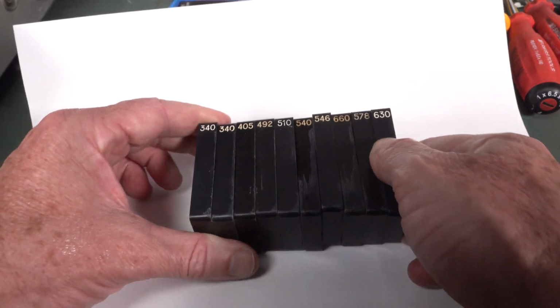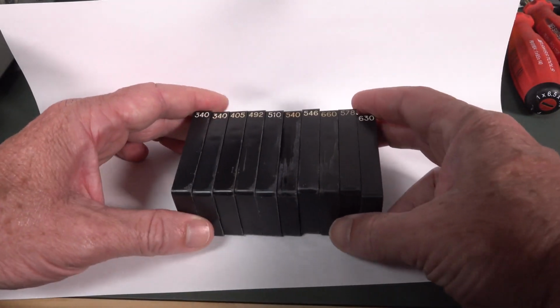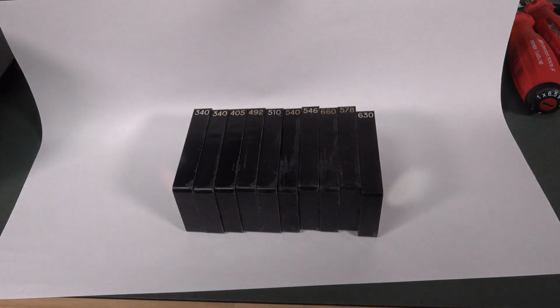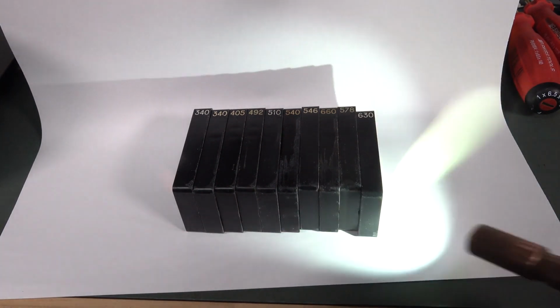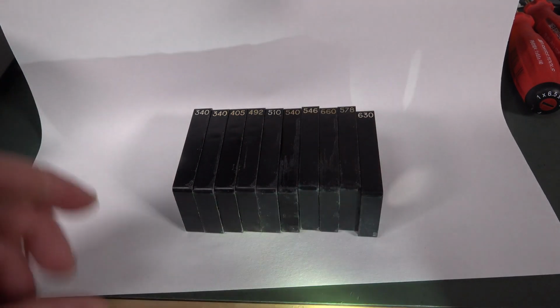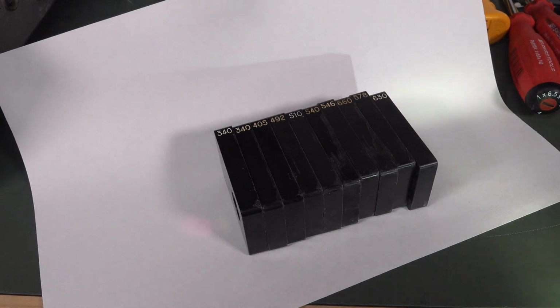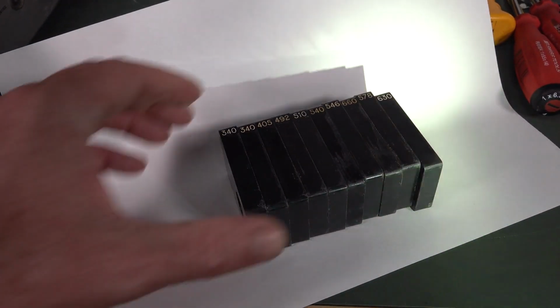So I thought we'd do a very crude test and just get a torch, not that flashlight of rubbish here in Australia, and shine it through these things and have a look at what comes out the other side. This camera is color balanced here.